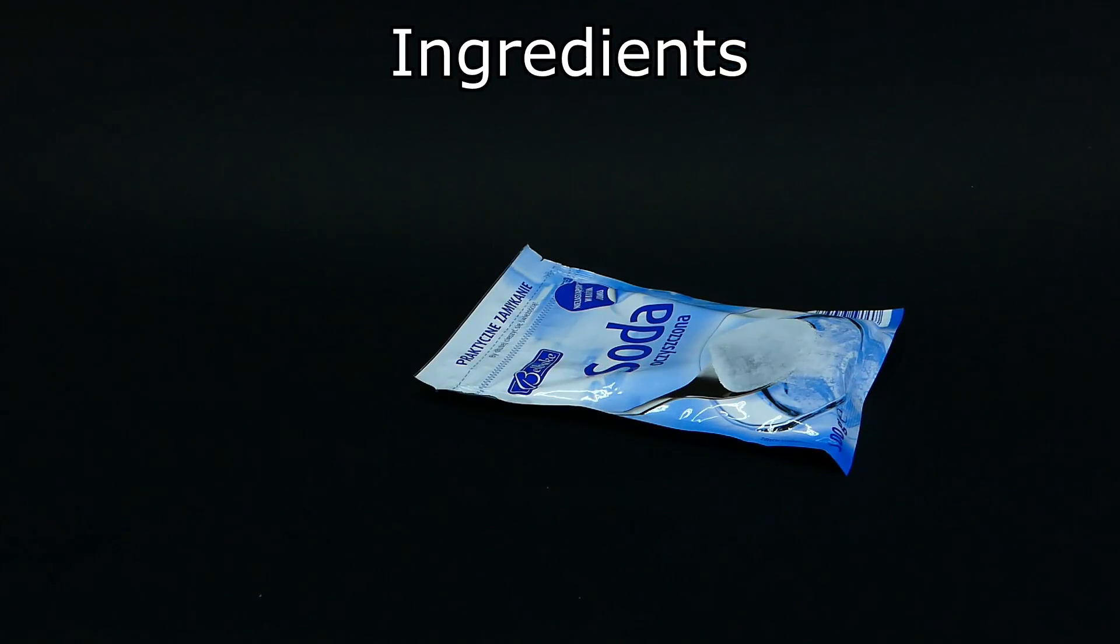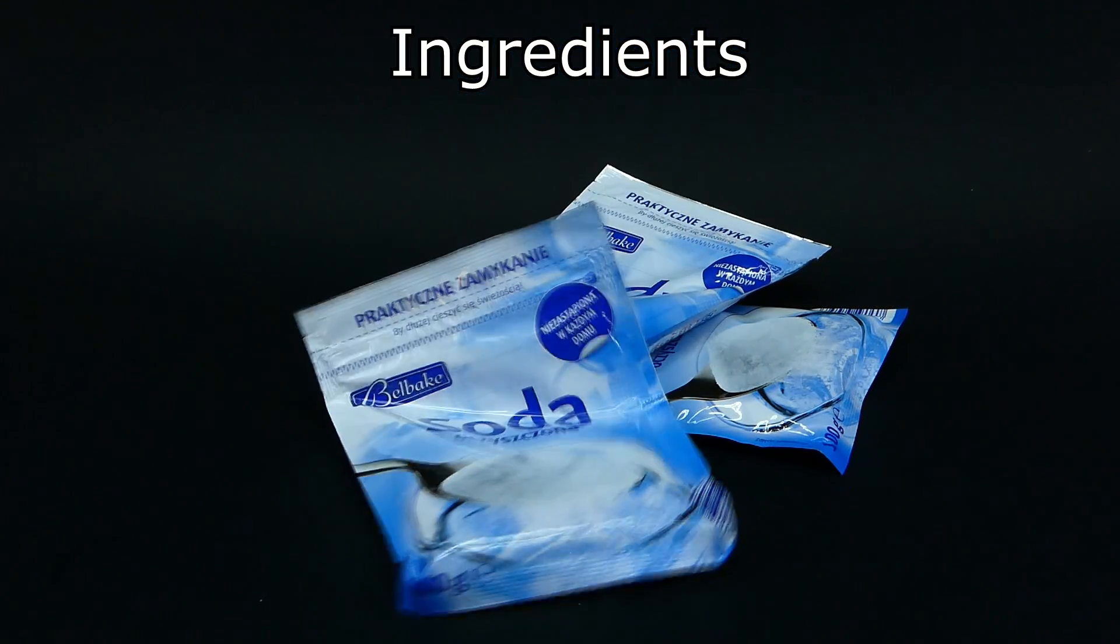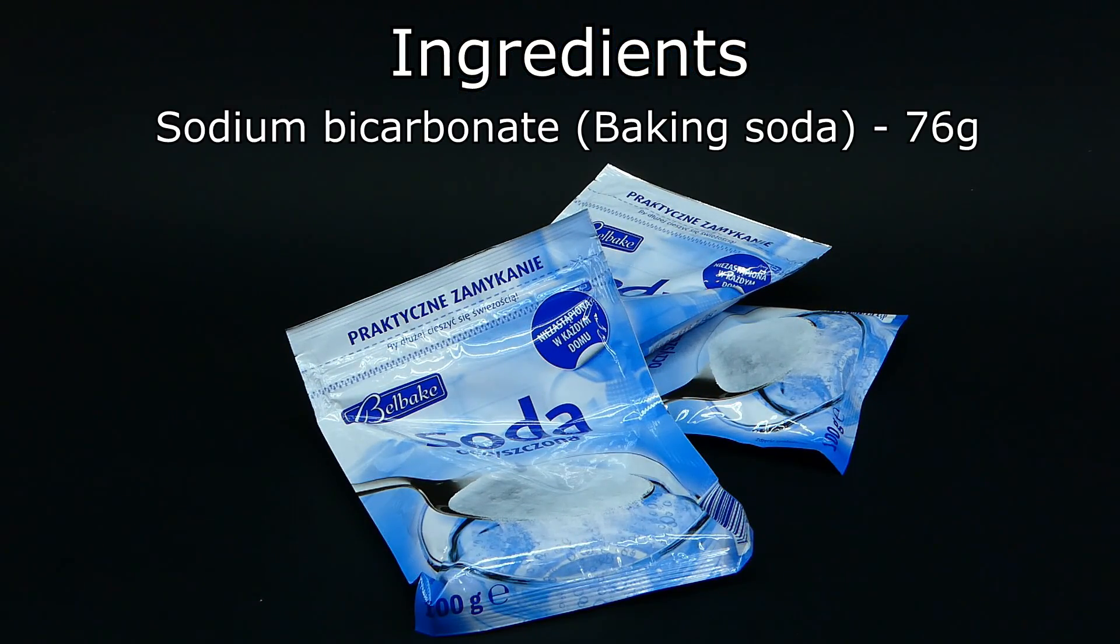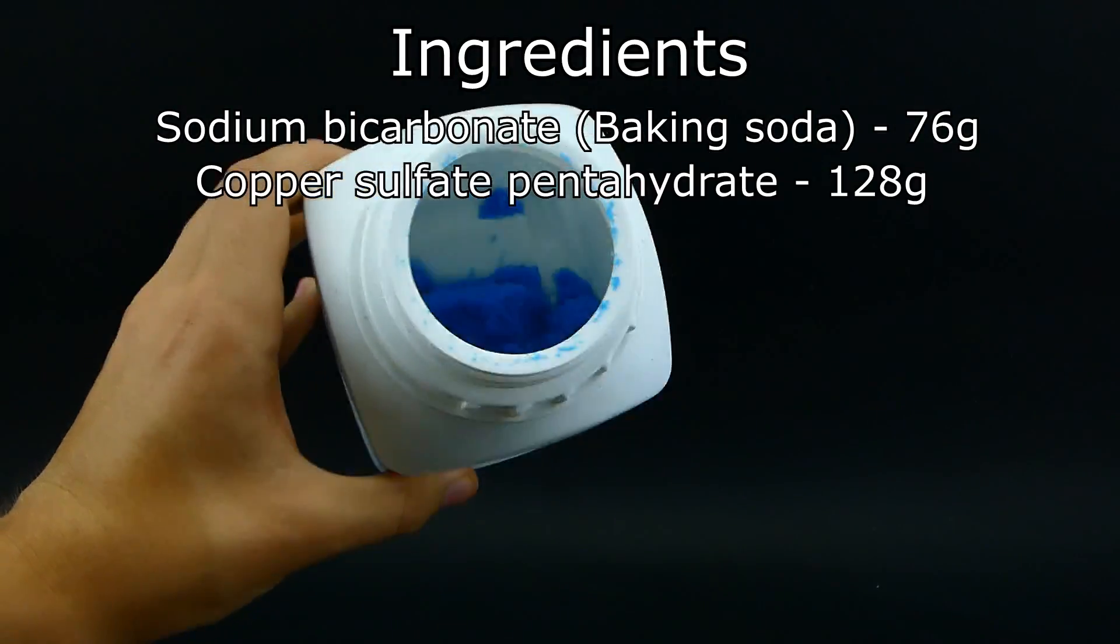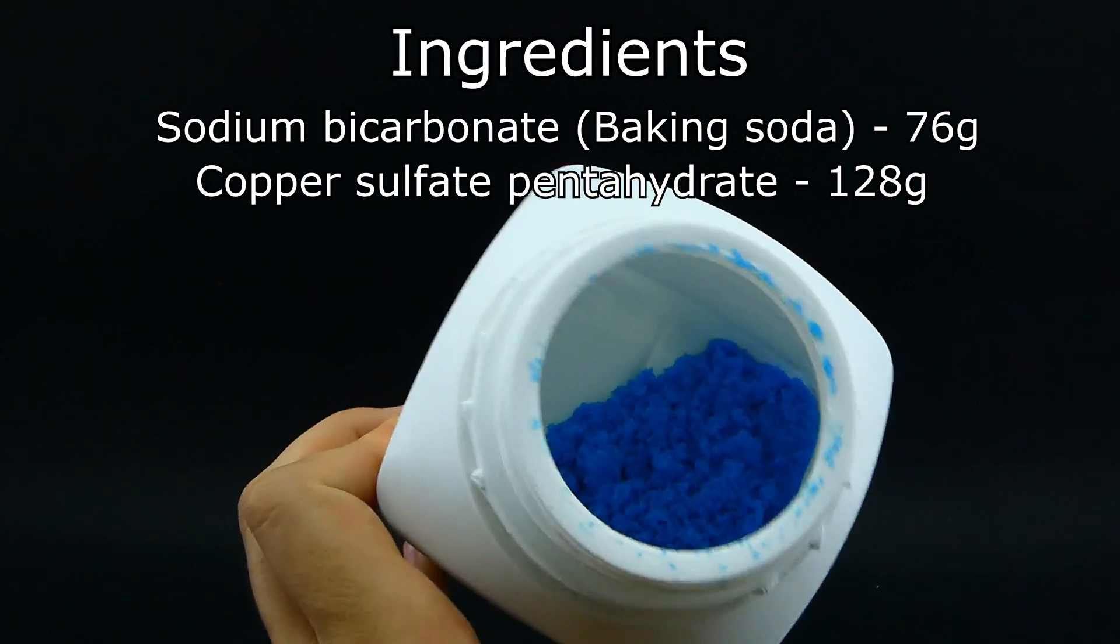The ingredients that you are going to need for this reaction are rather simple. You just have to get yourself 76 grams of sodium bicarbonate otherwise known as baking soda, and 128 grams of copper sulfate pentahydrate.